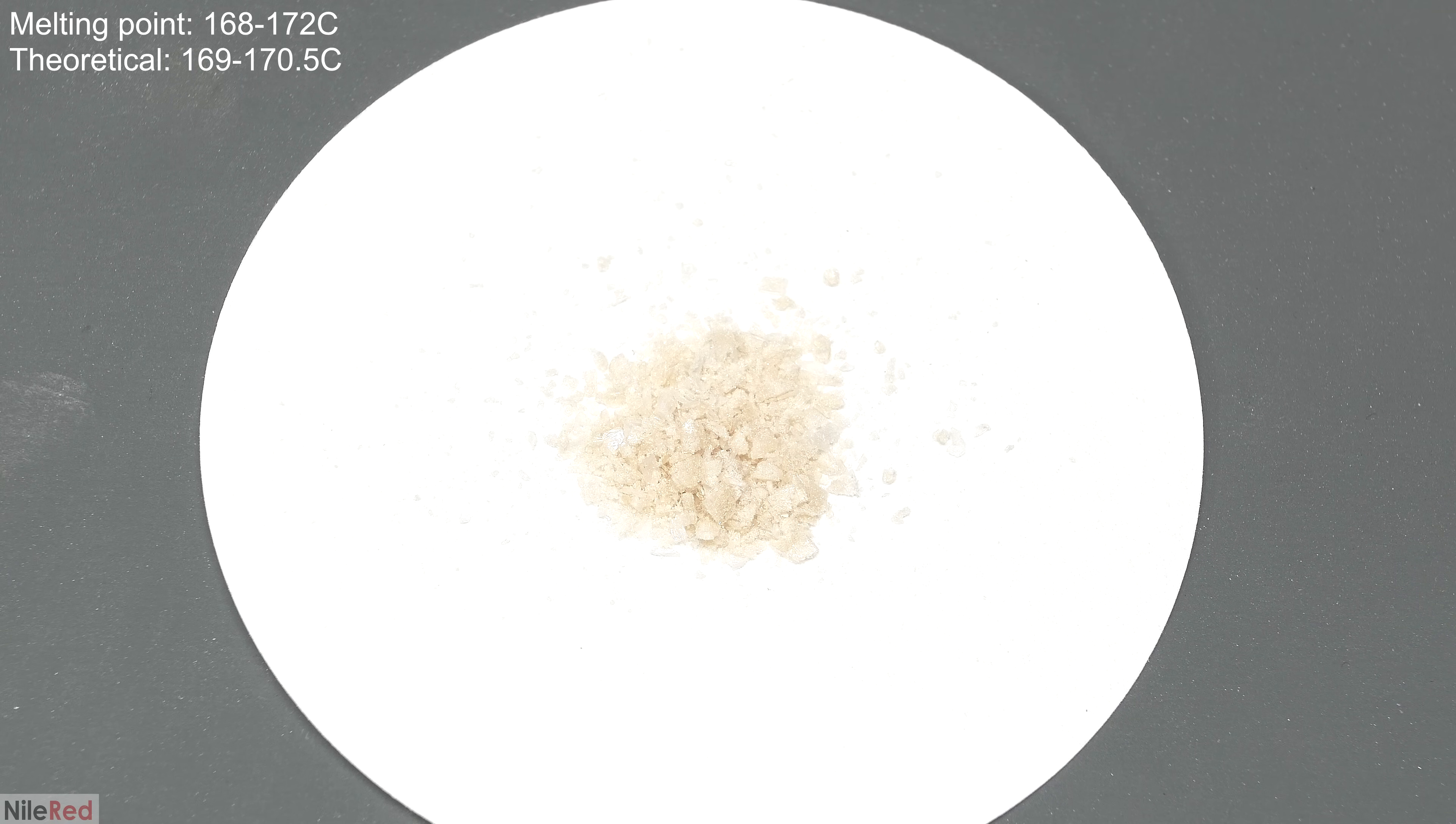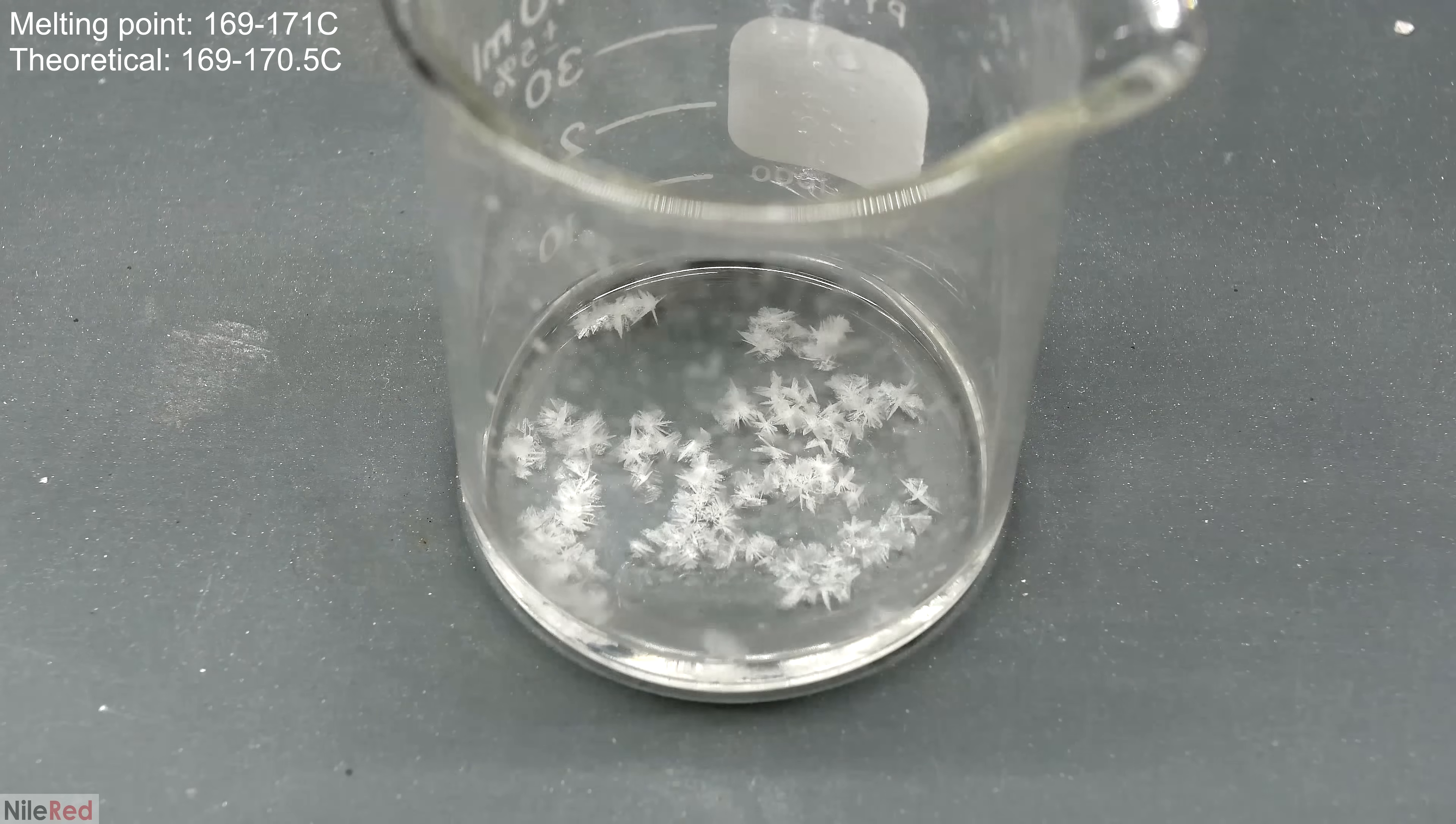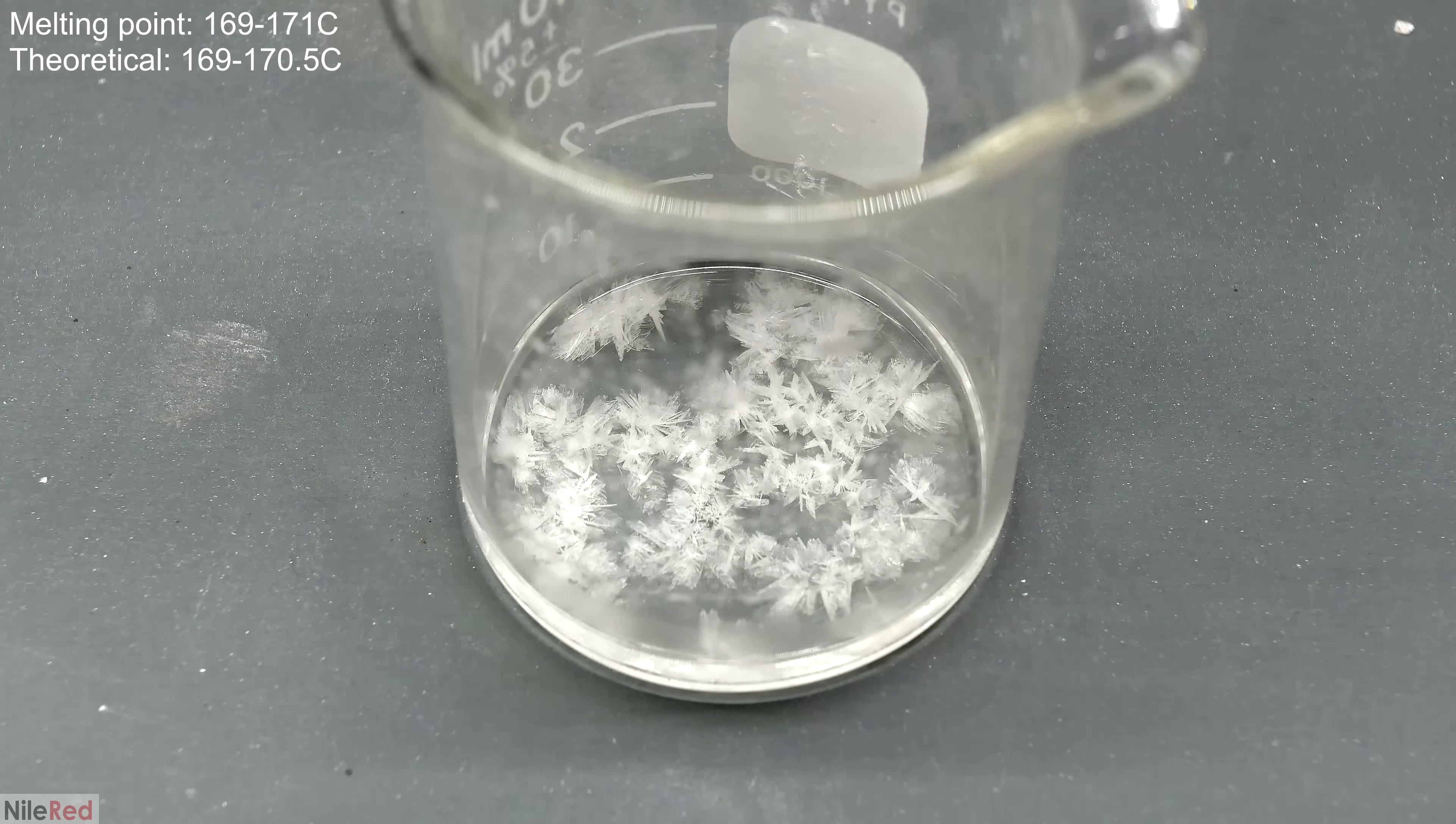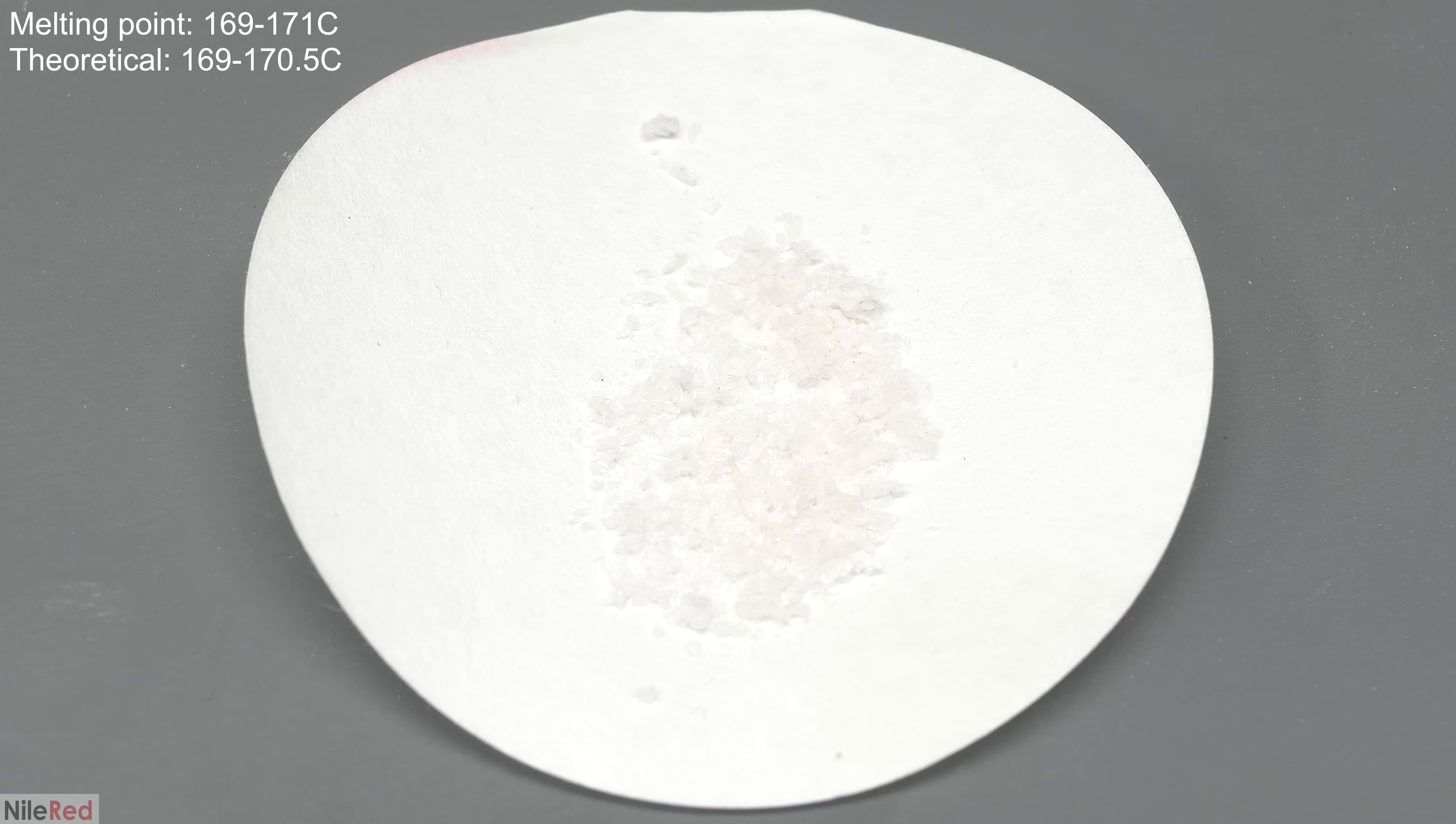To purify it even further, I carried out a third recrystallization. After the third one, I was left with a very clean product. I tested the melting point, and this time it was pretty much exactly the theoretical.